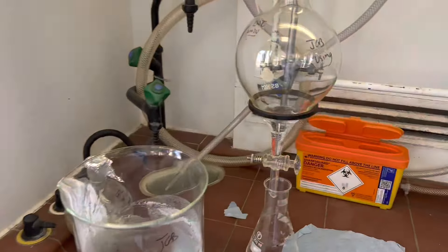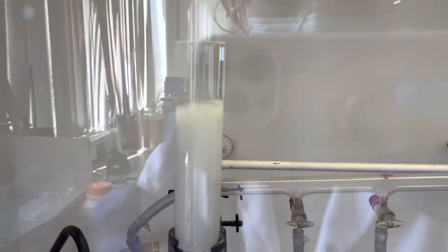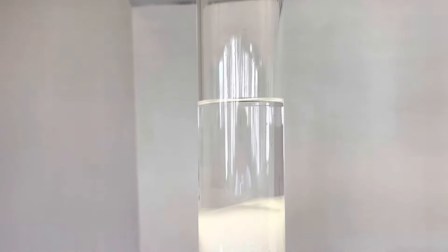As you can see, I prepared all of my solvents so they were ready to go once the column had equilibrated. What you're seeing here is me equilibrating the column by running the first solvent through to make sure the silica is saturated before I add my sample. In my work I don't usually use typical silica columns — we usually use SPE (solid phase extraction) or MPLC (medium pressure liquid chromatography), which is an automated system, and also HPLC. So doing a benchtop column is kind of weird for me.